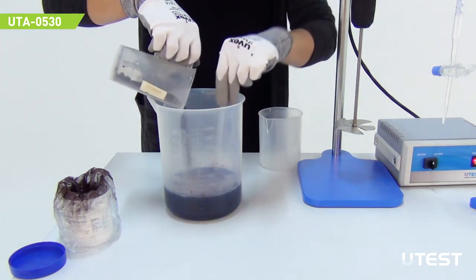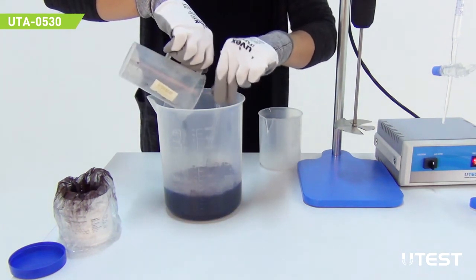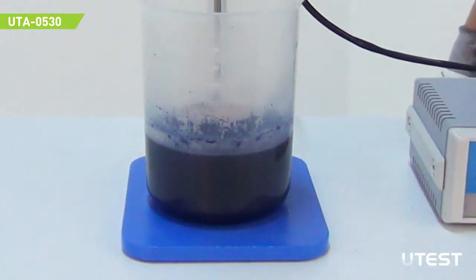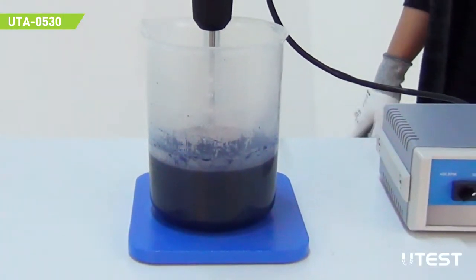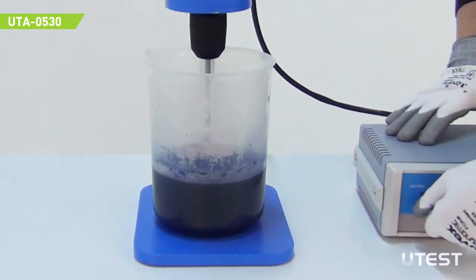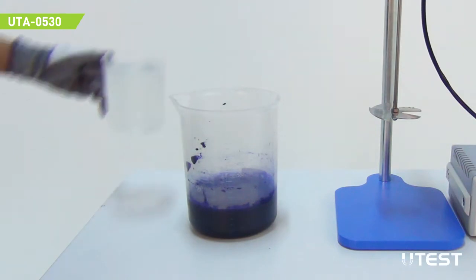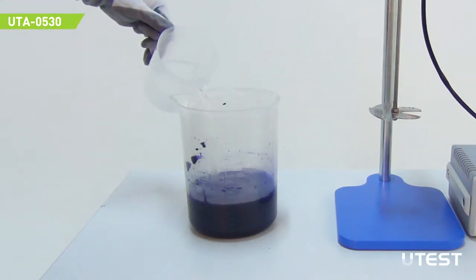Add 10 gram dry methylene blue while mixing slowly. Mix the solution 45 minutes until the solid dissolves and the mixture is cooled down to 20 degrees Celsius. Add distilled water till you have total 1 liter solution.